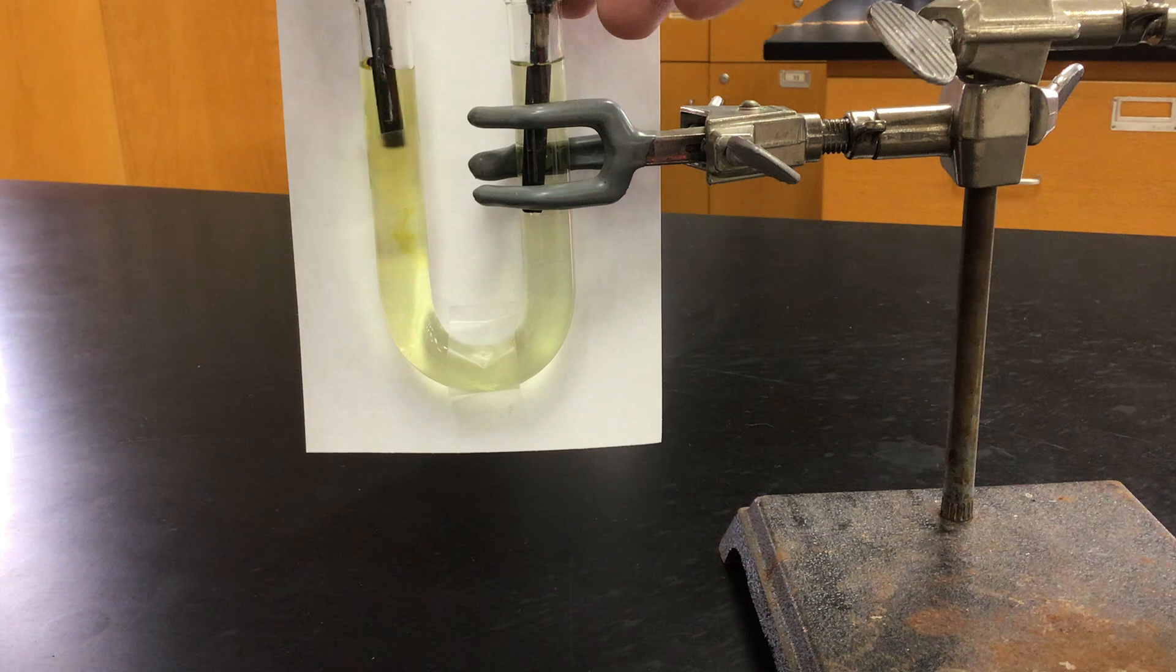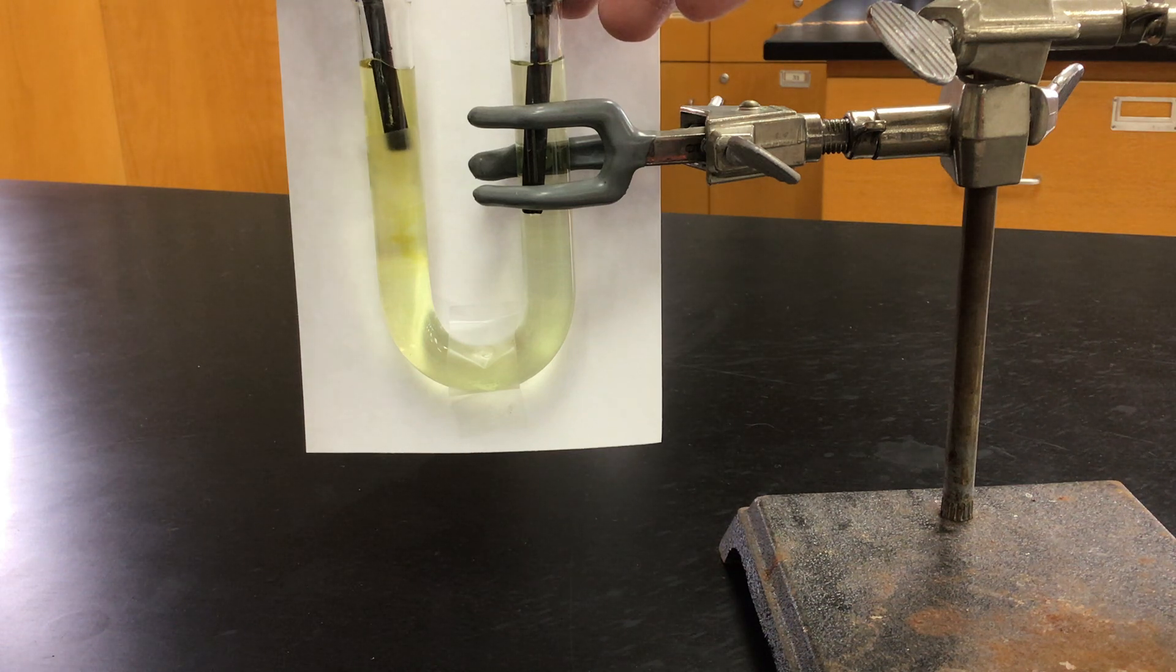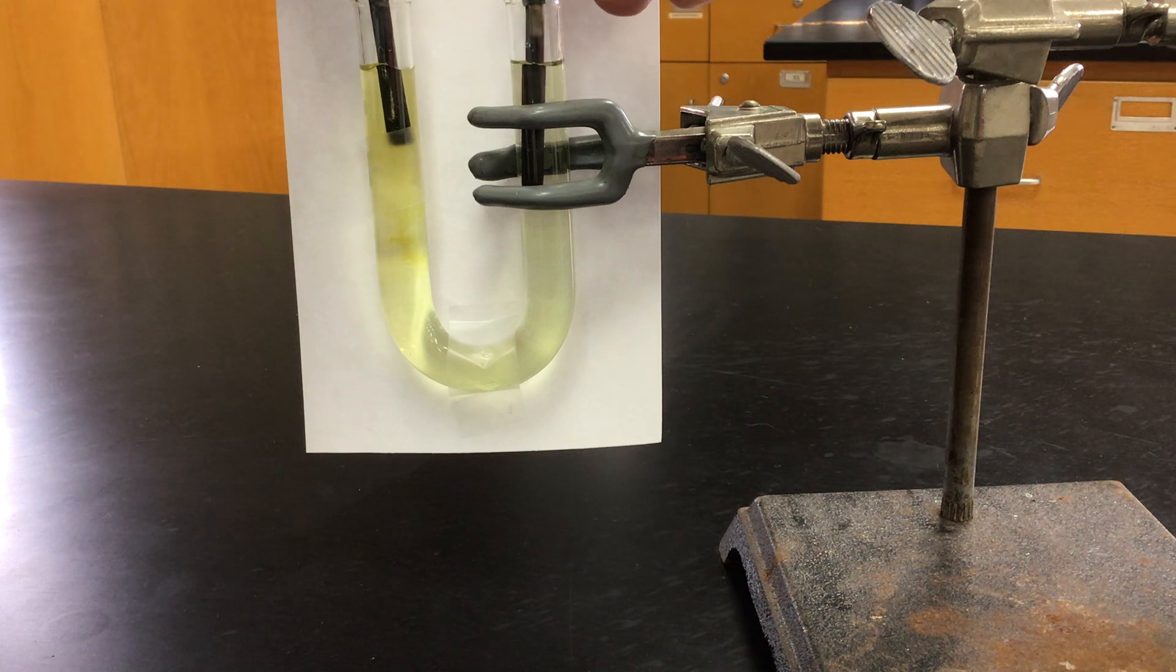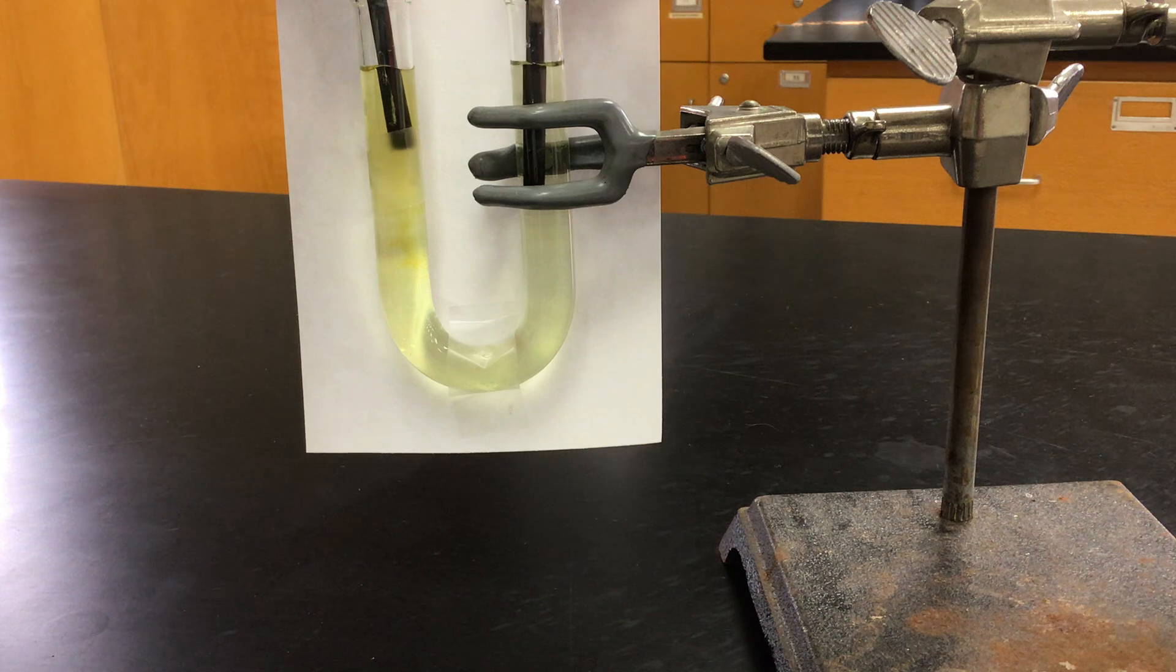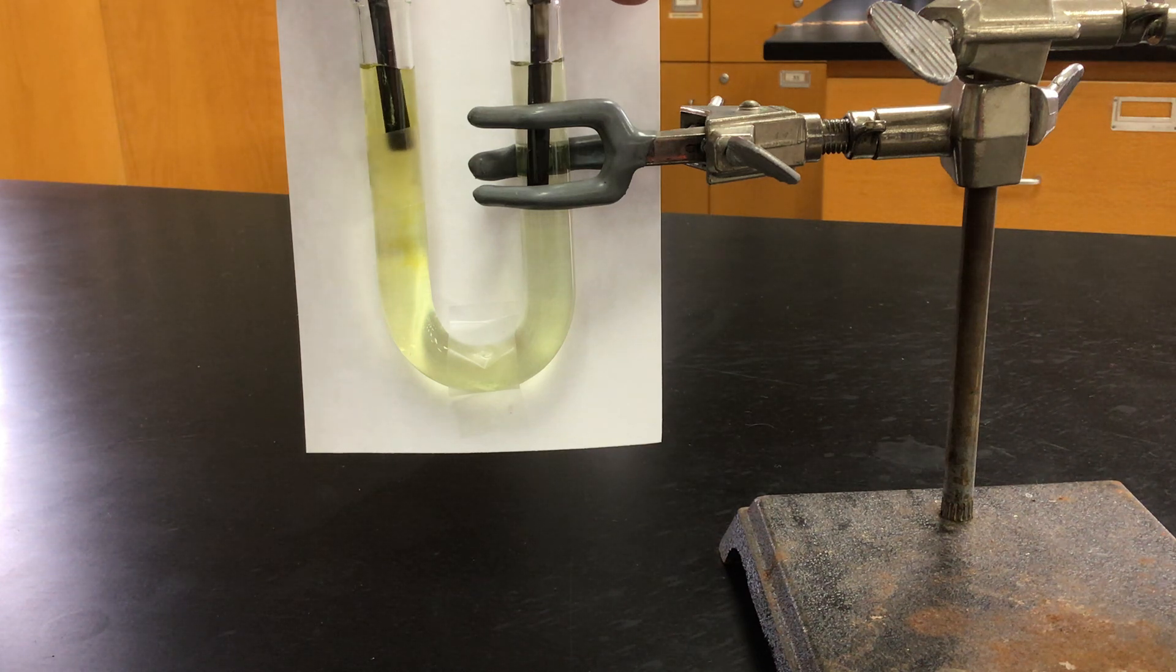I think that I see that happening on the left-hand side here. And we're going to test for that here in a moment, and we're also going to test for the pH. So I'm going to drop these electrodes in the same configuration in another U-tube so we can do both those tests.